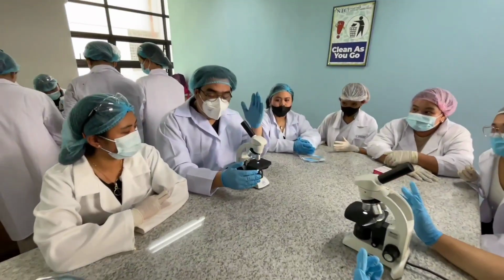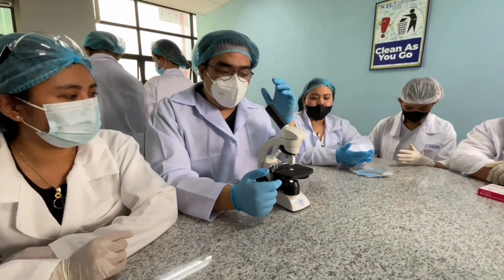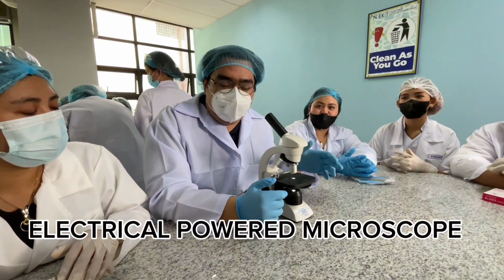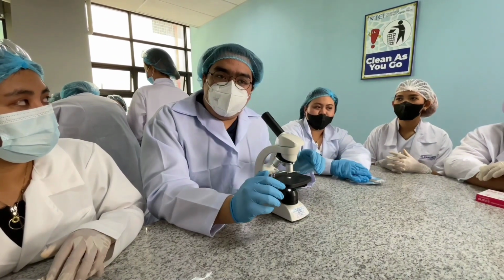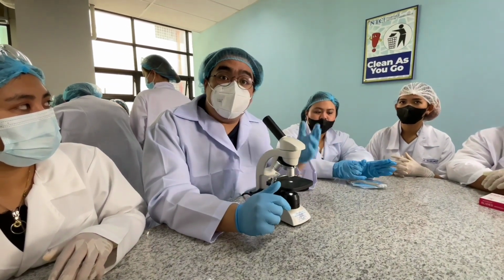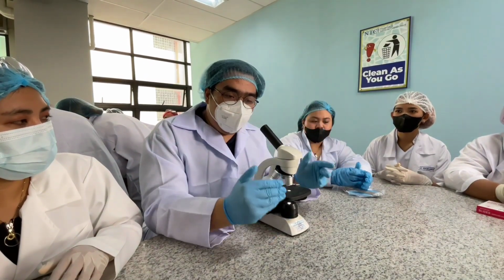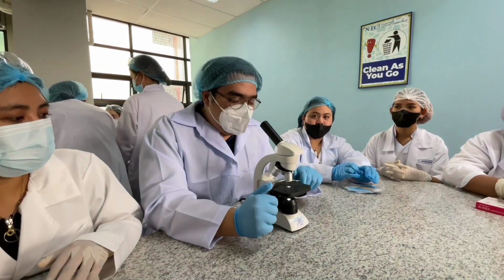Now this in front of me is what you call your typical electrical powered microscope. Compared to the traditional light powered microscope, which gets its source of light from the sun, we have our own light here.